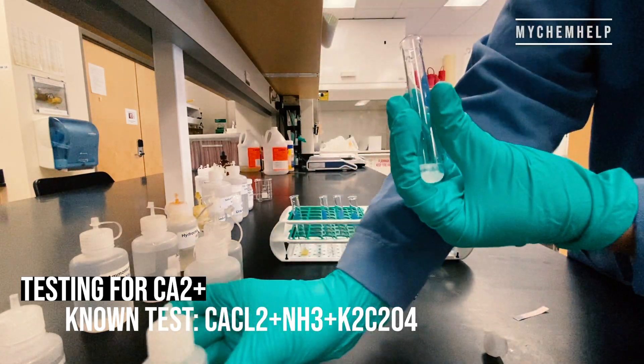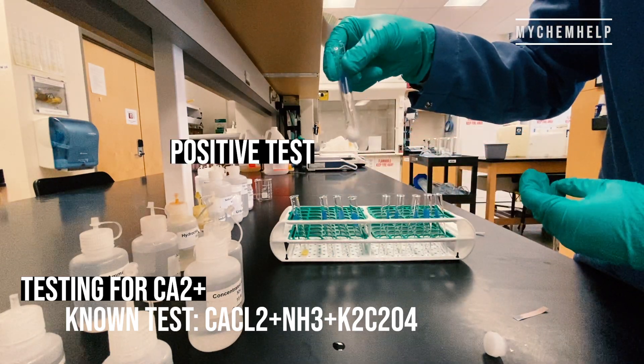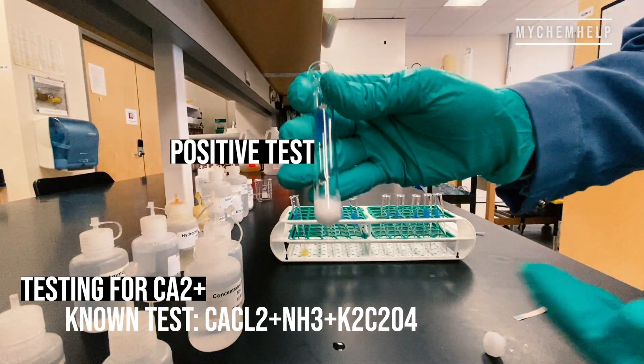That white precipitate there signifies a positive test on this one.